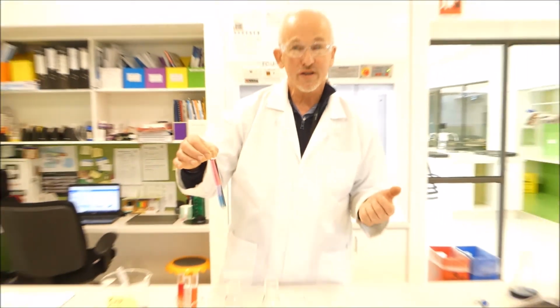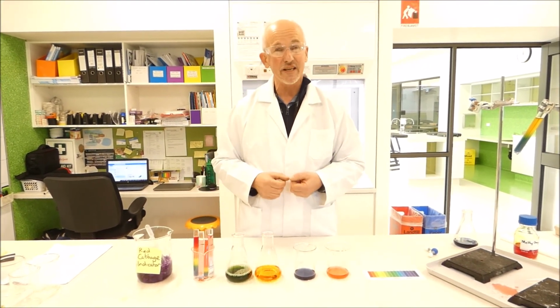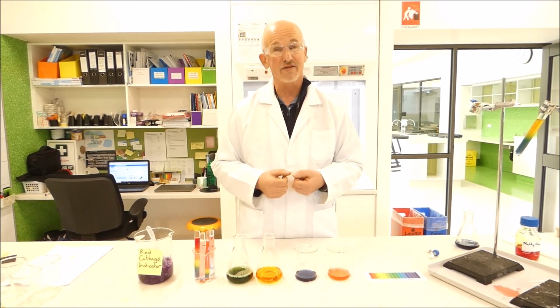So I hope you've enjoyed today's experiment. I hope you've learned a little bit about indicators, and in coming years in chemistry you're going to do an awful lot more with them and have a great deal of fun.